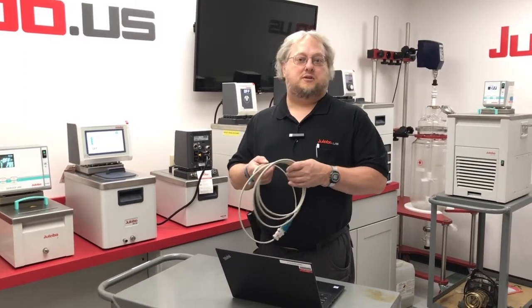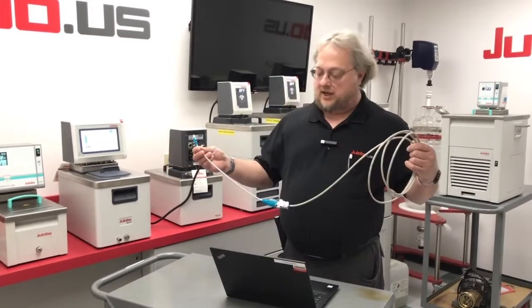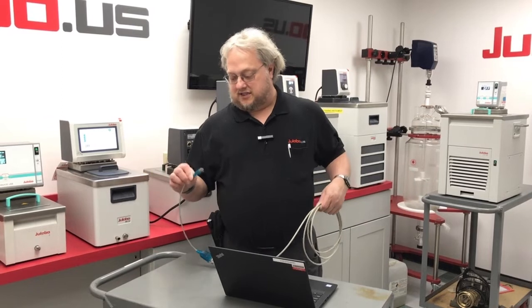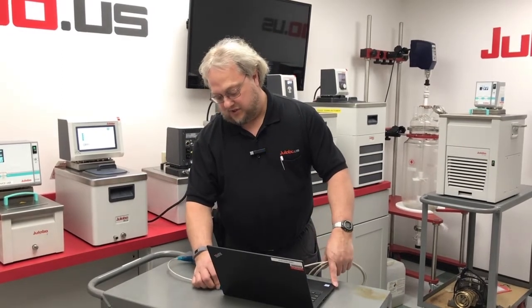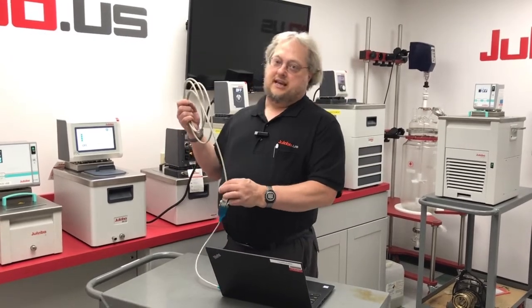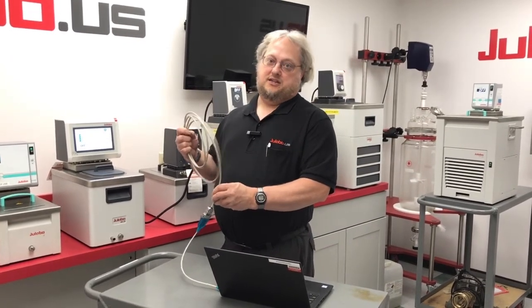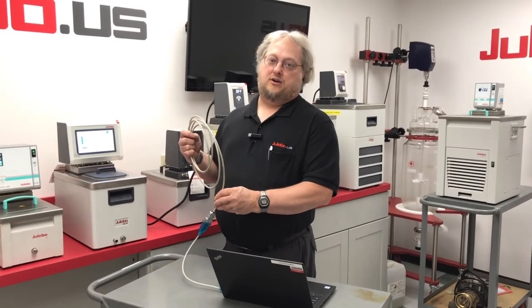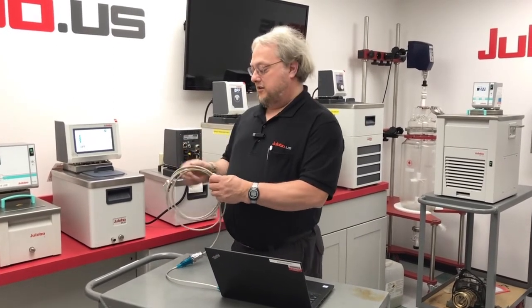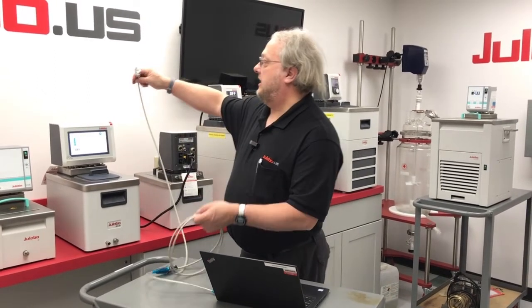Since most computers these days do not have a serial port, we have a serial cable to USB that we sell as an accessory. You would simply plug that into a USB port. It also includes a null modem cable. A regular straight serial cable will not work with our RS-232 ports — it has to be a null modem cable. If you buy the accessory from us, you will get the correct cable.